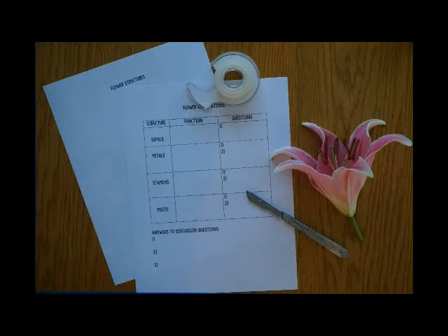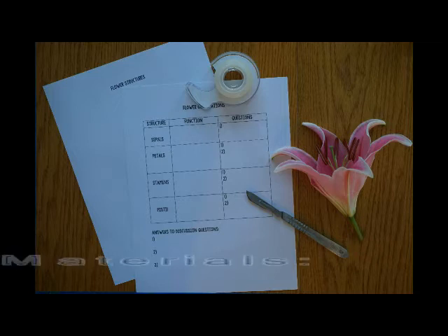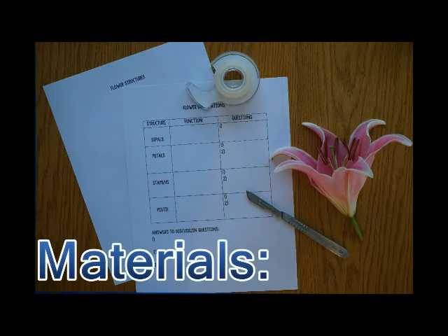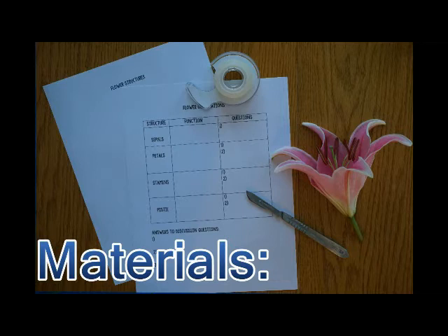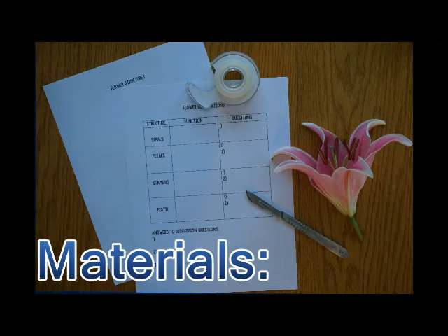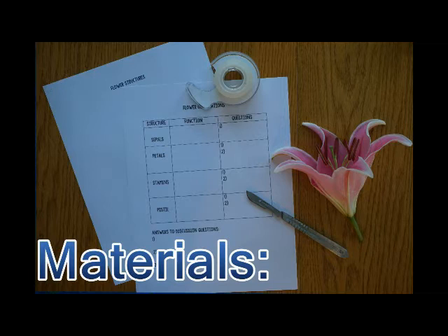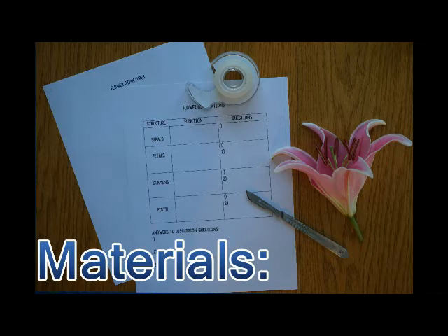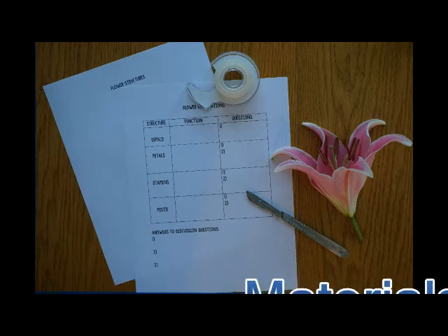Welcome to our Flower Dissection Lab. Your materials for today are your two lab worksheet papers, one labeled Flower Structures and one labeled Flower Observations, clear tape, a scalpel — you can use a knife if you don't have a scalpel — and a flower.